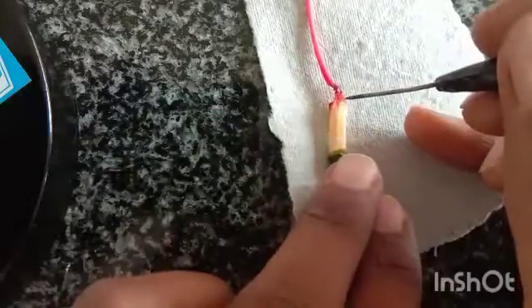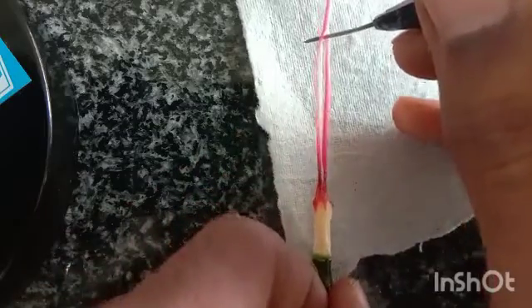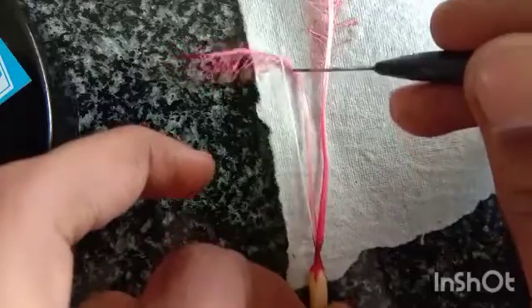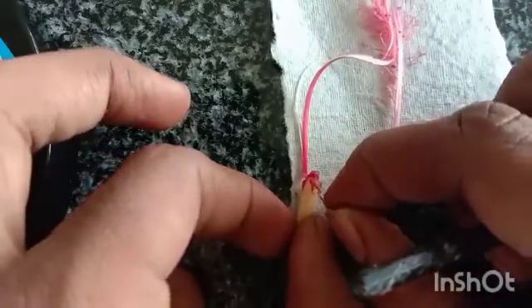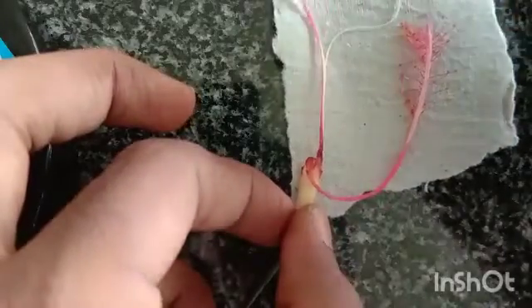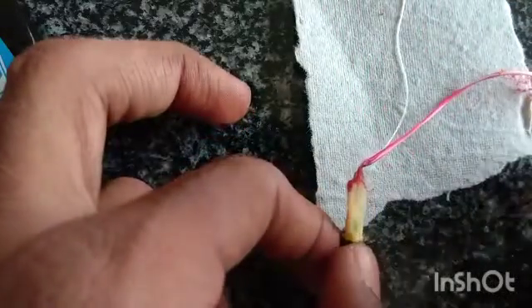Now dissect it with the help of needle. Insert the needle like this and drag it there. Can you see the style here? This is the style. And remove this androecium part. Carefully remove it. Like this. Remove this.